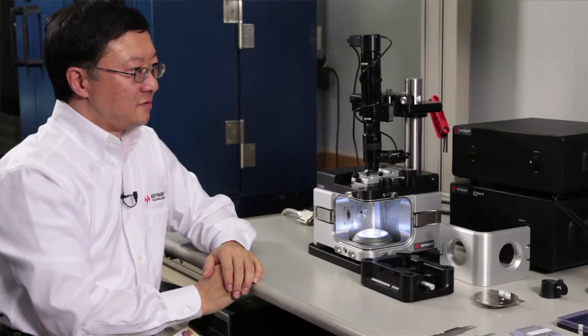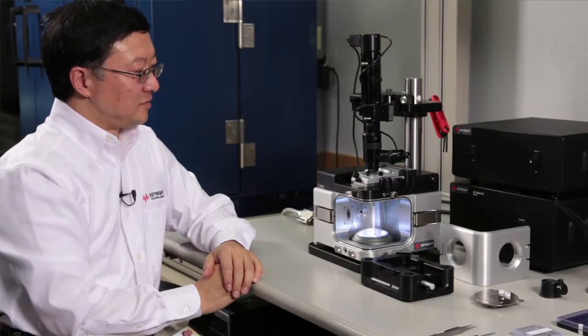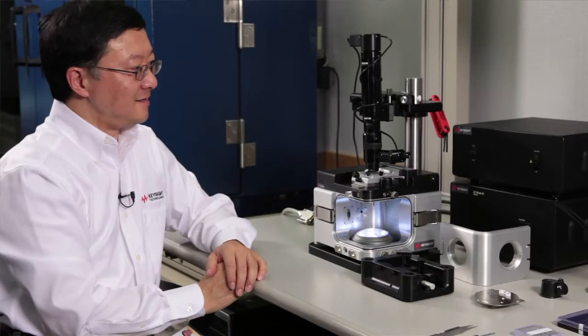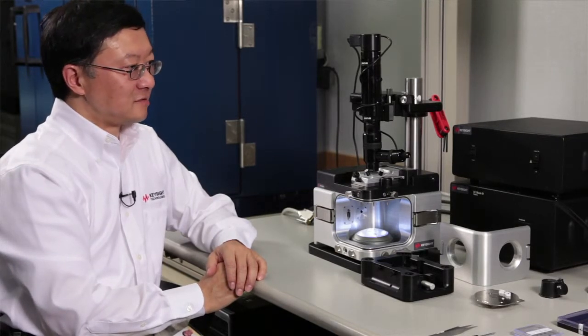Now your 7500 AFM is all assembled, set up. The optical microscope is aligned and it's ready for the next operation.